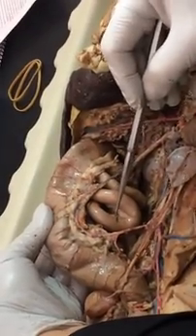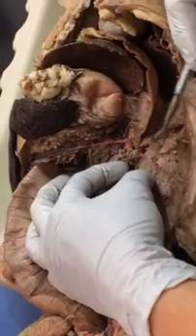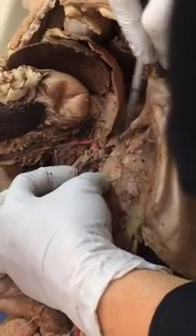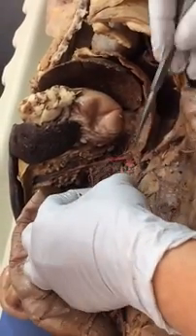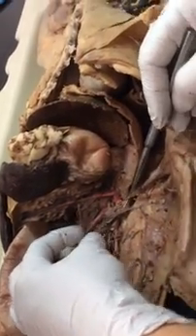Tell me more. Adrenolumbar. It's not as pretty on this cat as it could be on others. What I mean by pretty, this cat has quite a bit of blood and tissue on. It's adrenolumbar. Artery and vein. Artery's pink, vein is blue. Here's this cat's adrenal gland, but there's not too much left of it anymore.